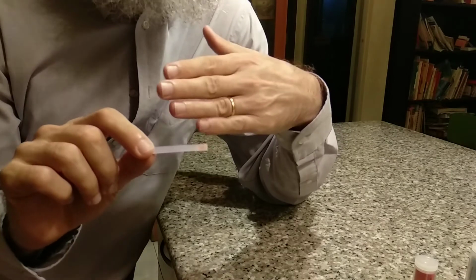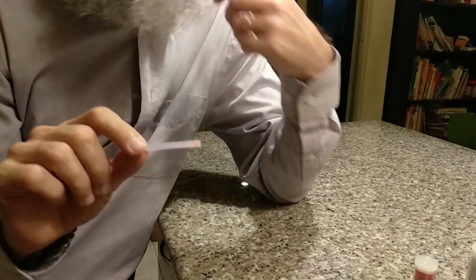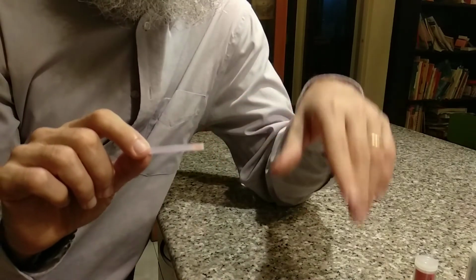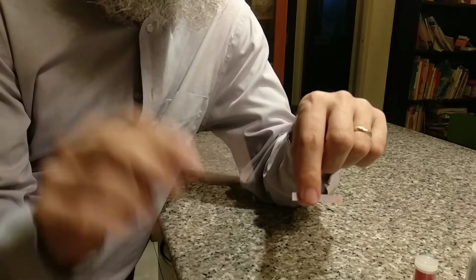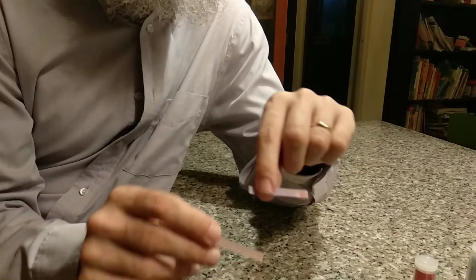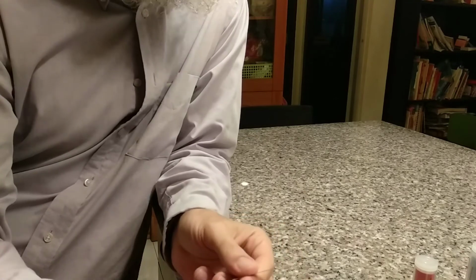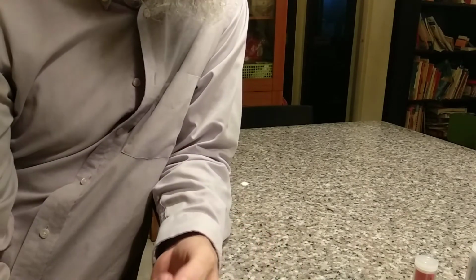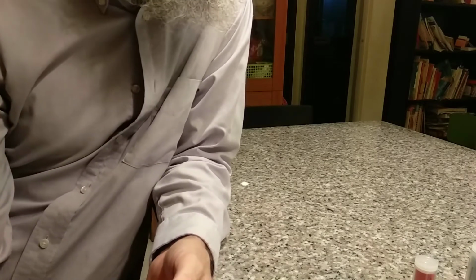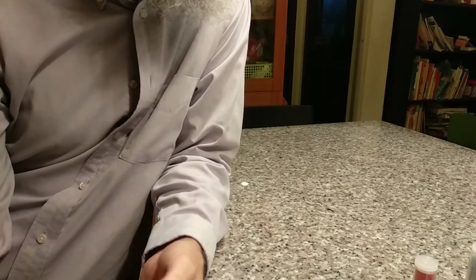So if you have something that's just a little bit acidic, it can change the color. Or if you have something that's just a little bit basic, it could change the color of the red litmus paper. Okay, so we'll come back to our litmus paper there. So one of the characteristics of acids is that they cause indicators to change color or indicate in some other way.